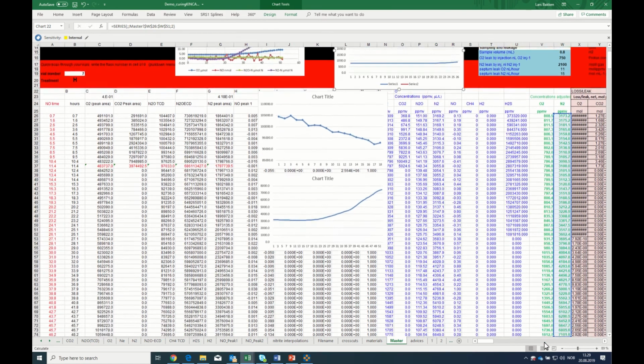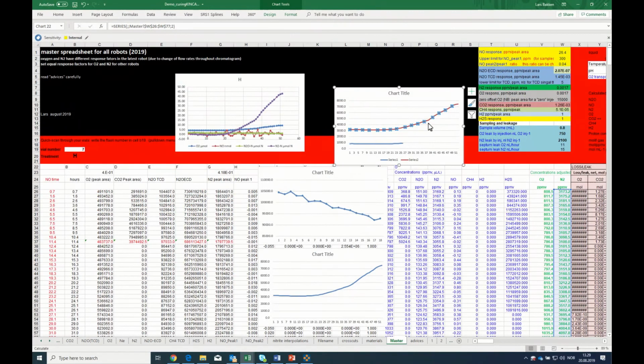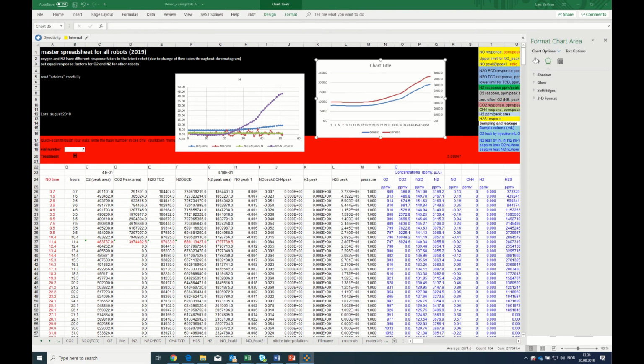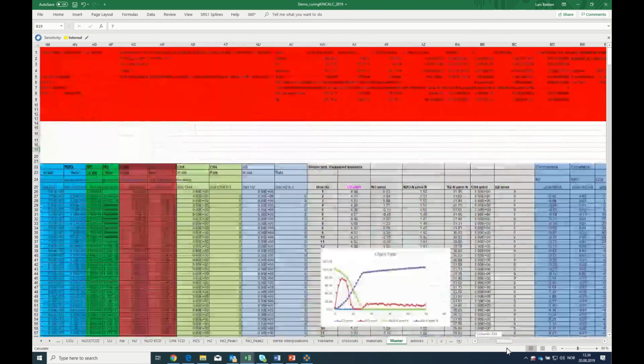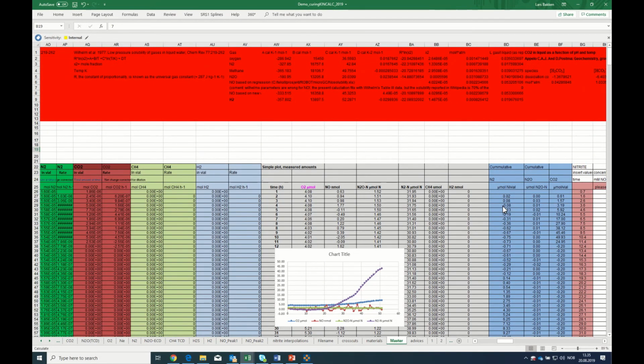But as I told you, the escalating N2 that you see here, by inspecting my experimental vials, I would have seen it. To convince you about that and to show you how you can inspect it, you can take your high standard, which has apparently a massive leak towards the end of the experiment. The spreadsheet is calibrated based on making the graph horizontal during the first 17 samplings. And now I can use my spreadsheet to calculate for vial number 7, which is the high standard, and I get a calculation of the apparent accumulation of N2.